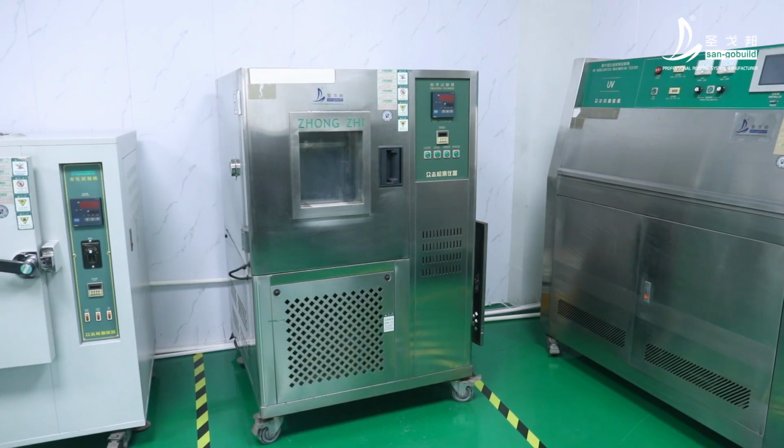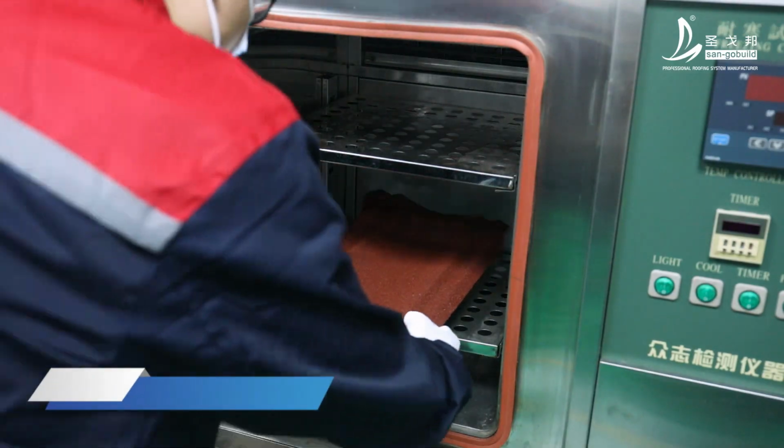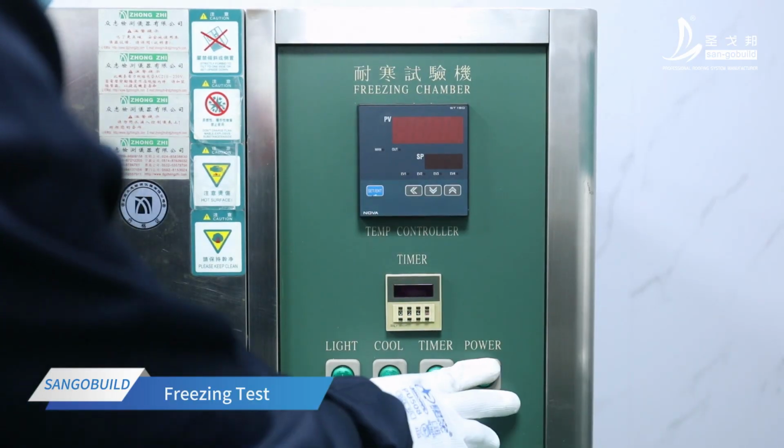Send the cut sample to the stone-coated roof tile laboratory. The laboratory technician carries out a freezing chamber test on the sample. Put the sample into the machine. Start the machine for testing.